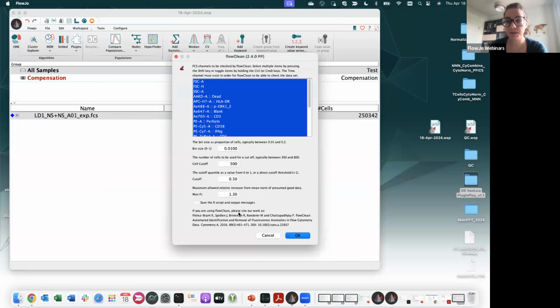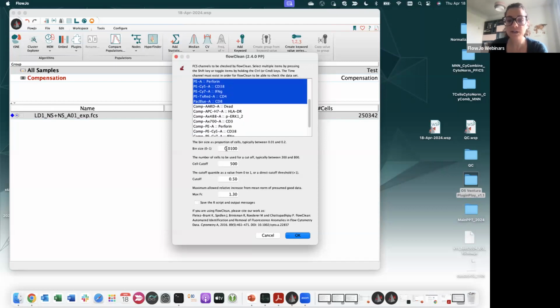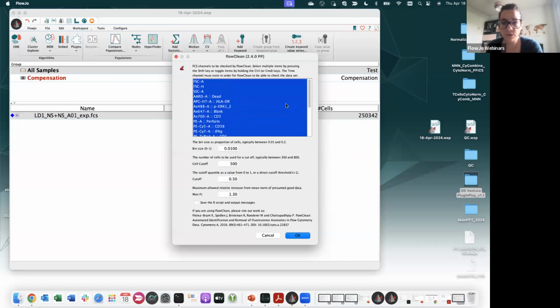If you want to go deeper into that, there is an automatic selection of the parameters. And underneath, you will find some parameters that can be fine-tuned. If you want to know more about these, you can hover over with your mouse and see exactly what is going to happen if you change these parameters. Usually, I start running these algorithms with the default values, and then look if I need to fine-tune something or not. So then you can click OK, and it will start running.